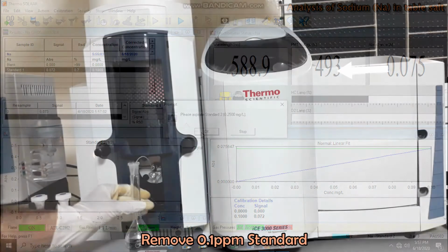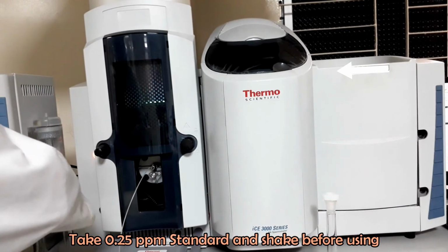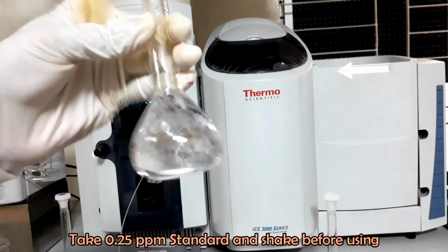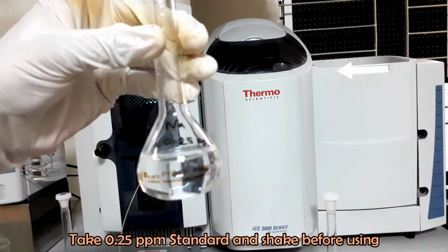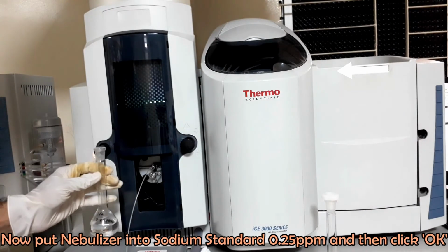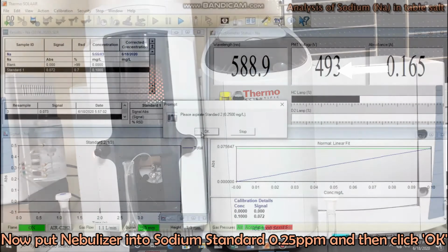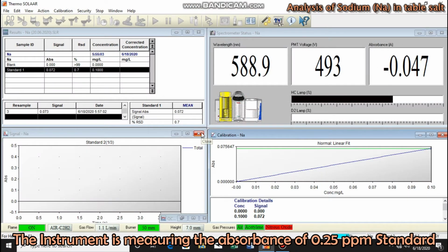The instrument is asking for 0.25 ppm sodium standard. Shake the standard flask. Dry the nebulizer and replace the 0.1 ppm standard with 0.25 ppm sodium standard. Click OK. The instrument is measuring the absorbance of 0.25 ppm standard.